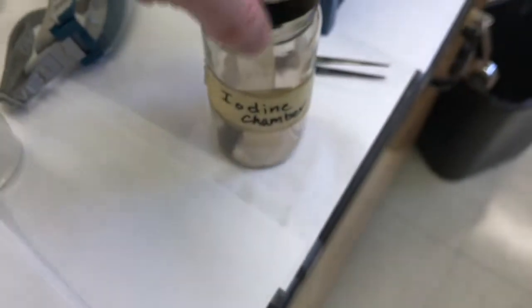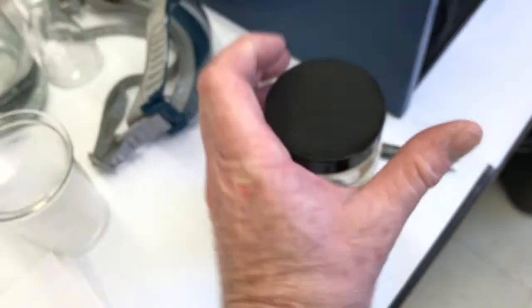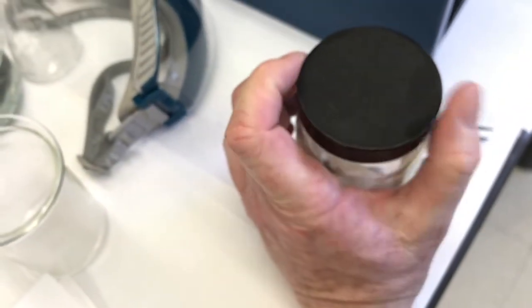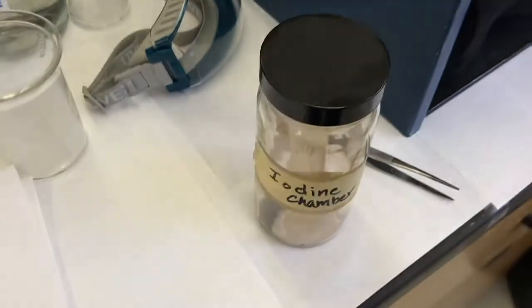I'm going to cap it again and let those iodine I2 molecules, gaseous I2 molecules, stick to my TLC plate. And the I2 will stick to certain molecules but not others, so some of the molecules will turn purple, some won't. So sometimes if you have 2 molecules with the same Rf under UV, you can put them in an I2 chamber and one of them will be developed by the I2 and the other one won't, so you'll know they're different molecules.